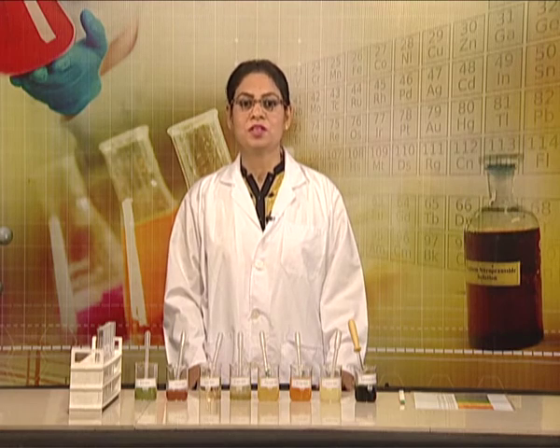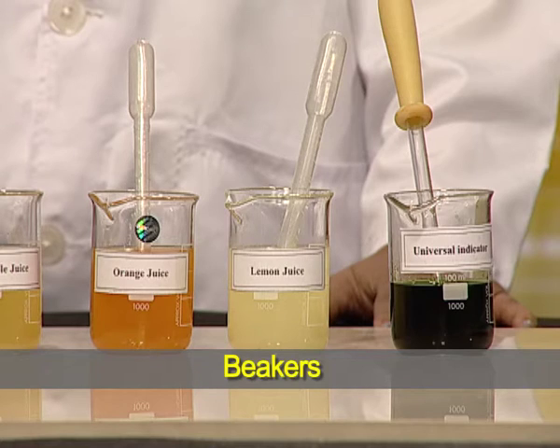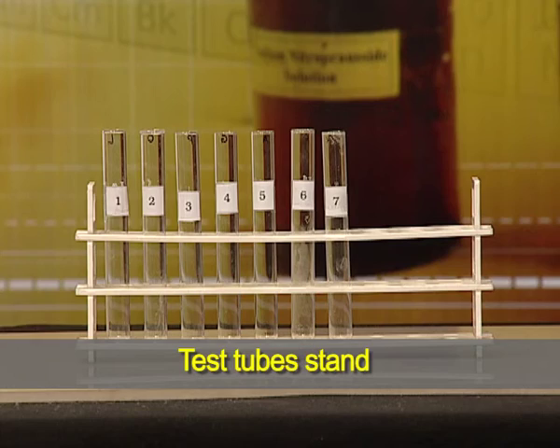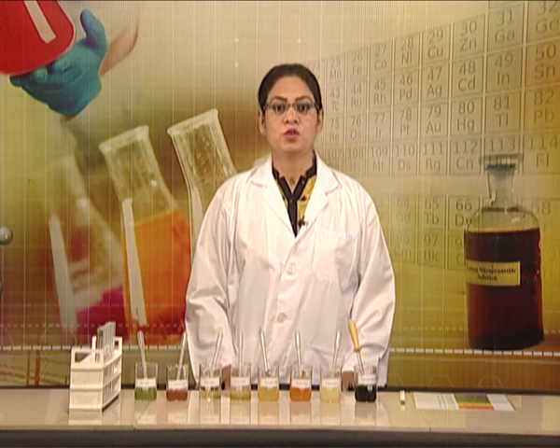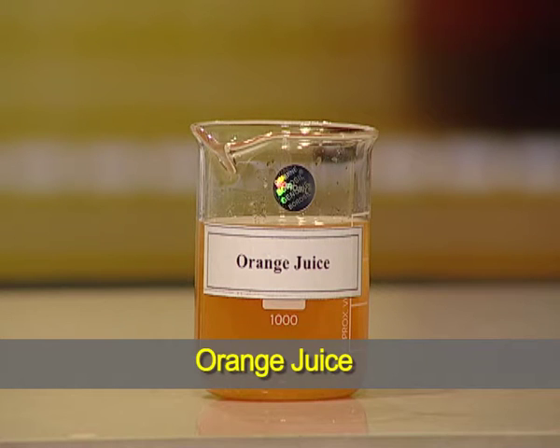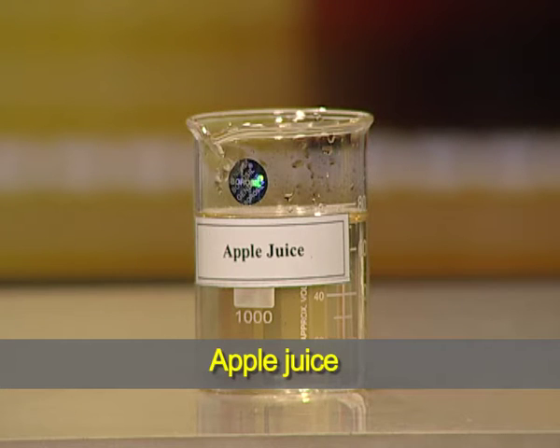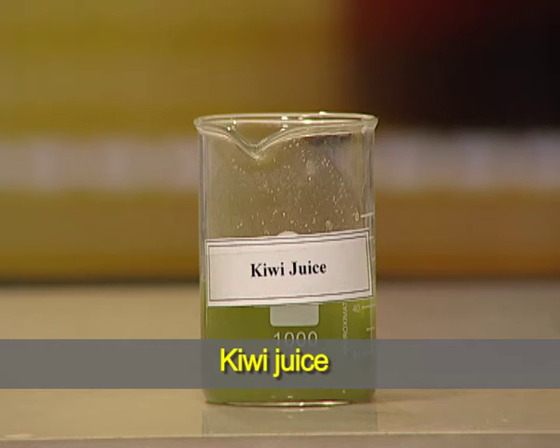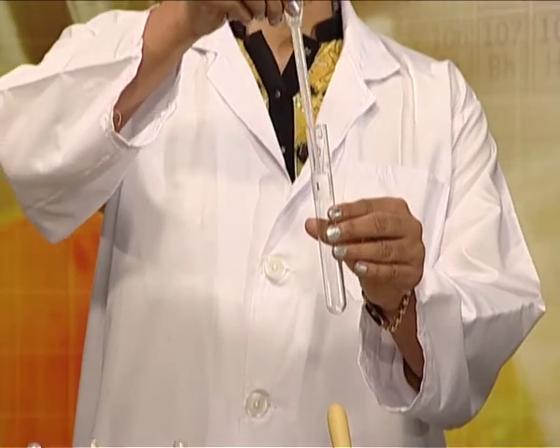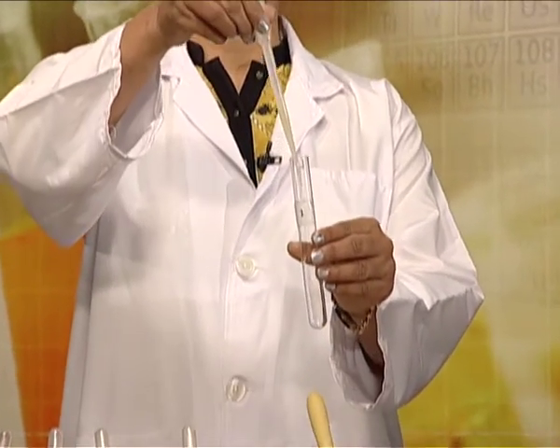Materials required for the experiment are test tubes, beakers, droppers, pH chart, pH paper chart, test tube stand and fresh juice of fruit and vegetables. Lemon, orange, pineapple, grapes, apple, carrot and kiwi are taken in different beakers. Now, I will transfer these juices with the help of different droppers in each marked test tubes.